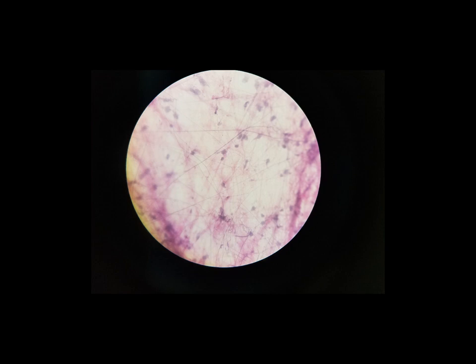So for areolar connective tissue, regarding cells, we're actually seeing the nuclei of the cells. And those cells are called fibroblasts. Now remember, if you've already watched the chapter 4 lecture video, when you see blast at the end of a word, it means to make. So fibroblasts make the fibers that we're looking at. And when we're looking at areolar connective tissue, there's two types of fibers that we can easily see.